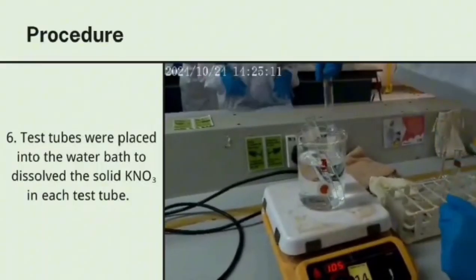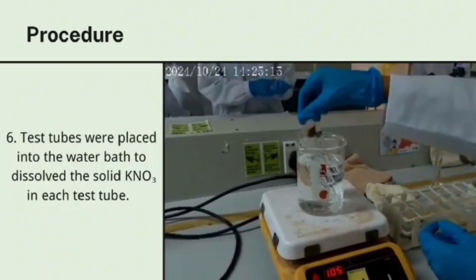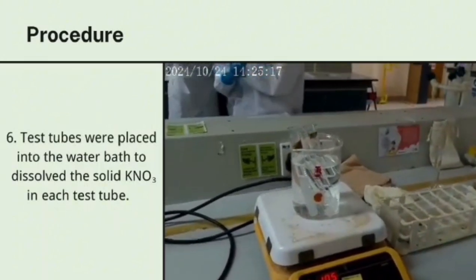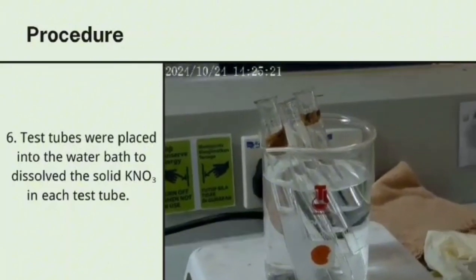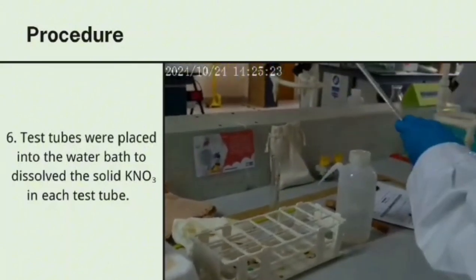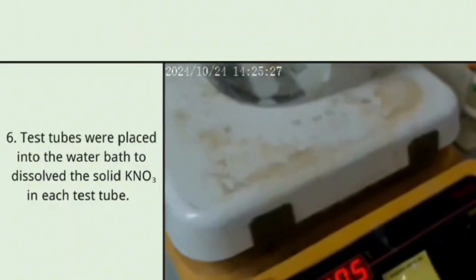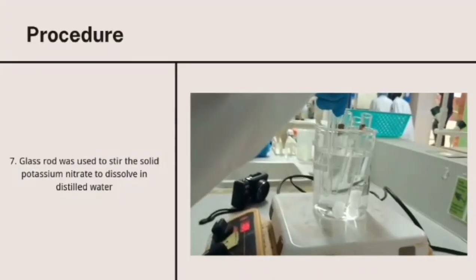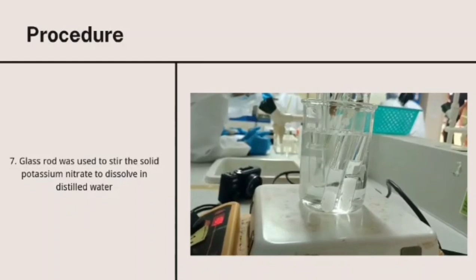Procedure 6. The test tubes were placed into the water bath to dissolve the solid KNO3 in each test tube. Procedure 7. A glass rod was used to stir the solid potassium nitrate to dissolve in the distilled water.